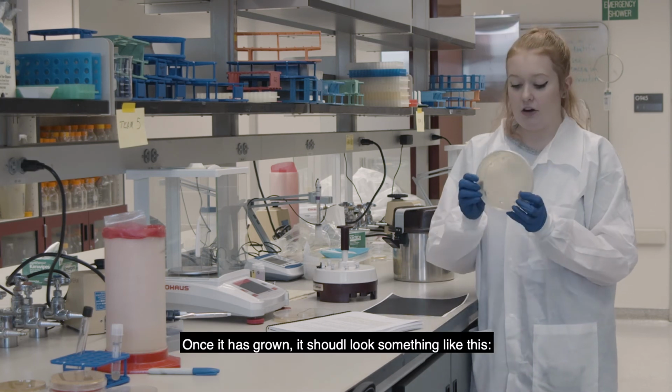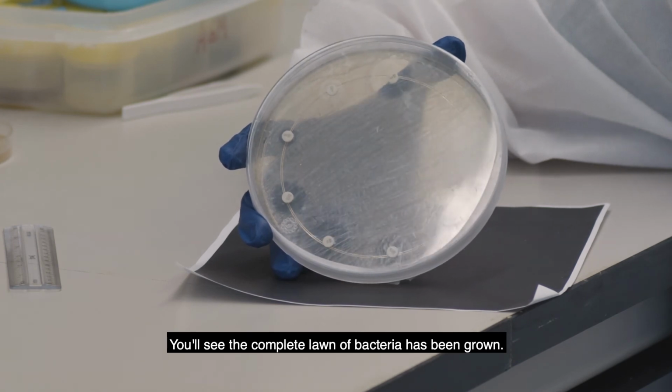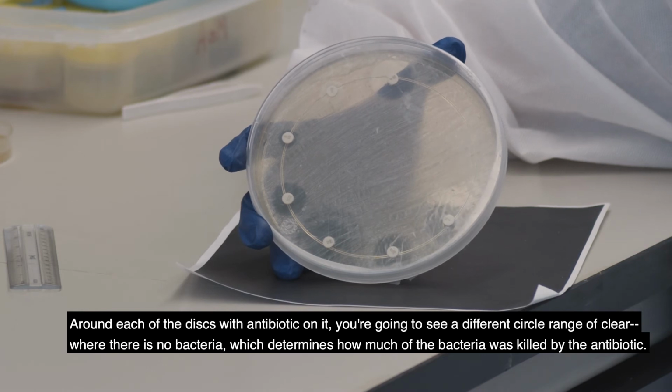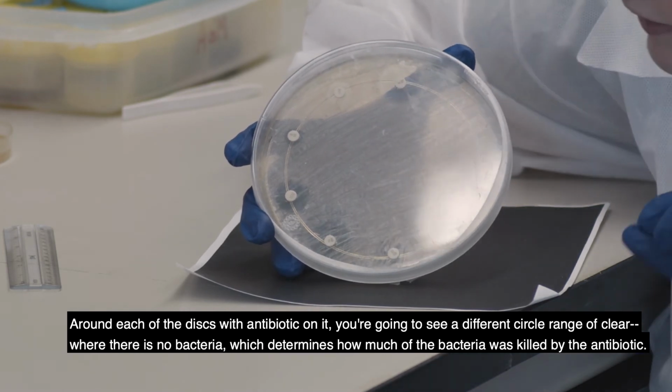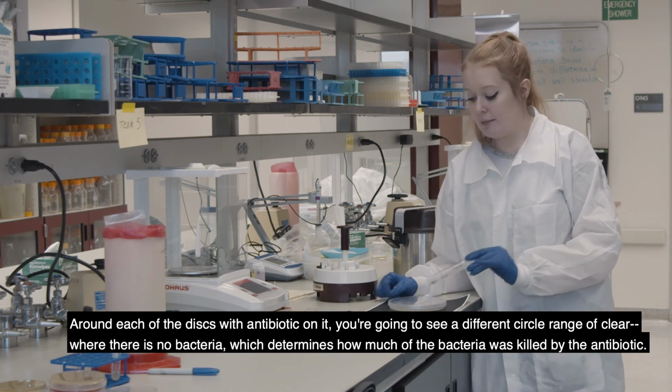So once it has grown, it should look something like this, and you'll see the complete lawn of bacteria that has been grown. Around each of the discs with antibiotic on it, you're going to see a different circle range of clear where there is no bacteria, which determines how much of the bacteria was killed by the antibiotic.